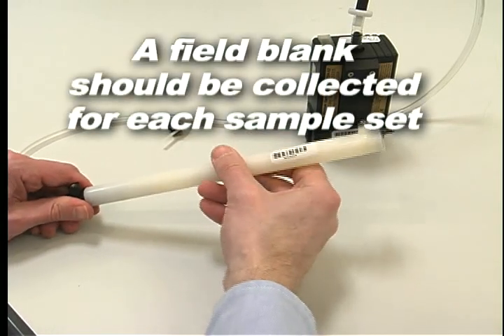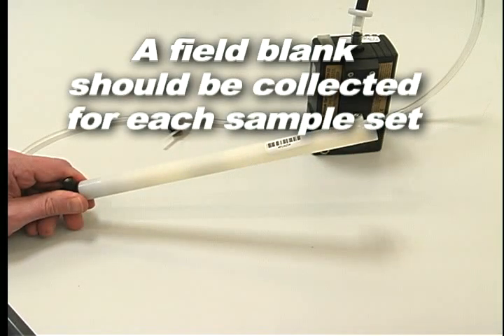Remember, a field blank should be collected for each sample set and should accompany the monitor during all periods except actual sampling.